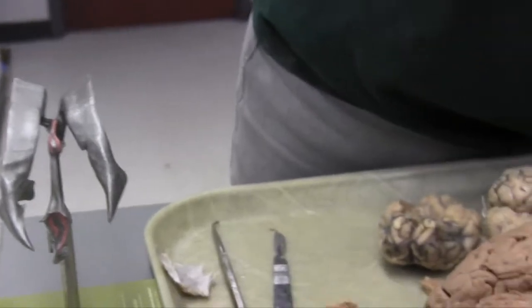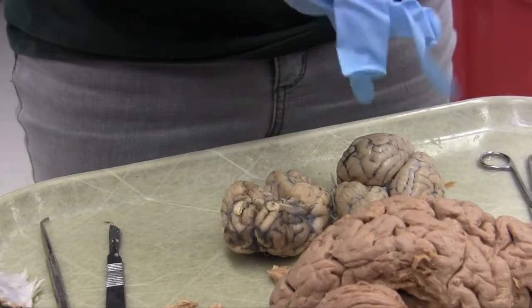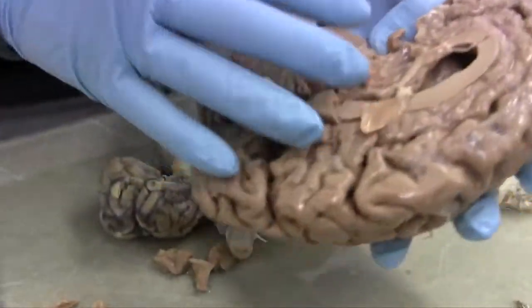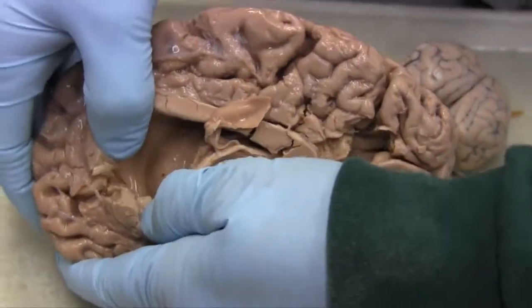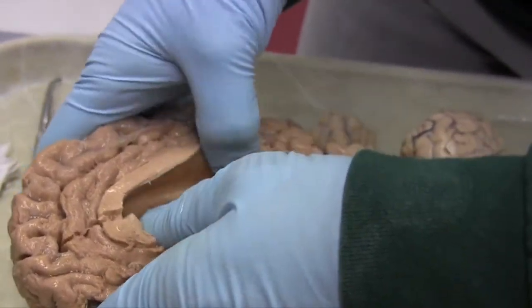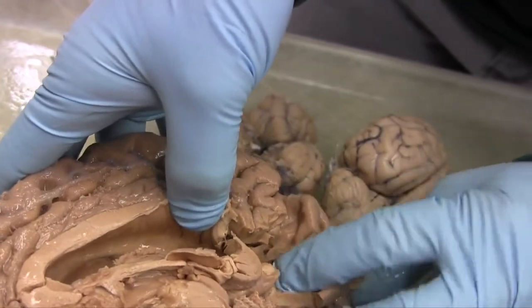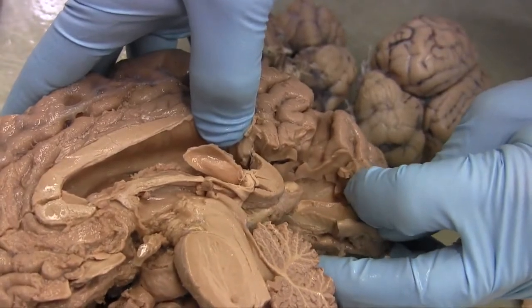Shall we just look at that one more time because it's so pretty? Okay, one more time. We're going forward to the front of the lateral ventricle, then back, back, back to the back pole, which is really close to the occipital pole of the brain.